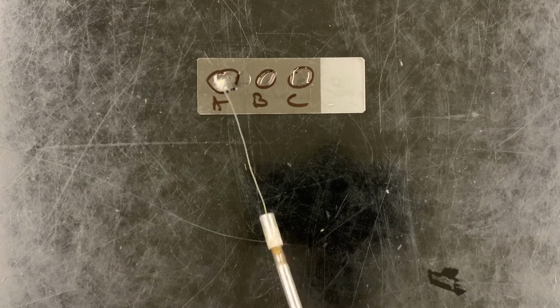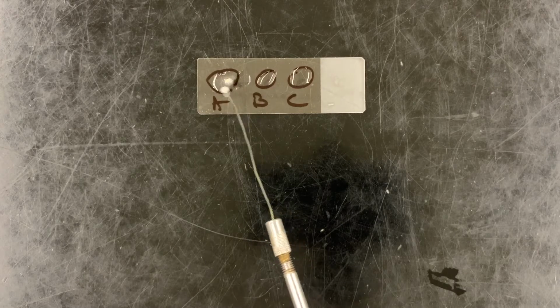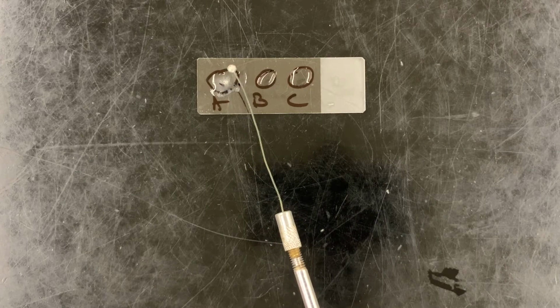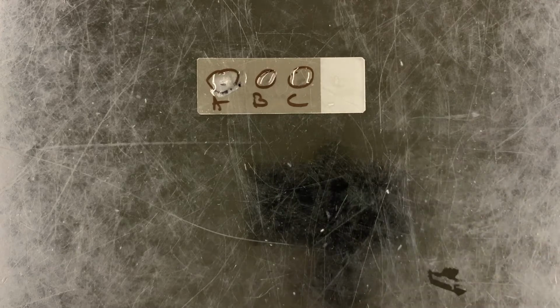Oh, what do we see? Look at that. Bubbles. So the bubbling here means that this bacterium is catalase positive, which then means that this bacterium is a staphylococcus. Now remember, the idea of the presumptive test is that we are using a very quick and very simple test to make a very quick presumptive assessment as to the nature of this bacterium.